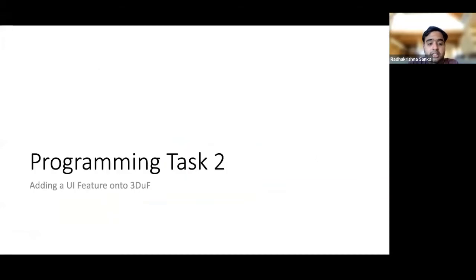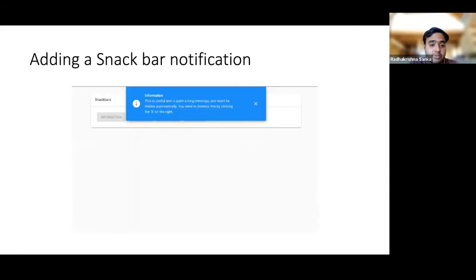Now the second task is adding a new UI feature. So in order to add a new UI feature, how hard is it to add something to 3DuF? And that's the good thing about version 2 of 3DuF. We've simplified how you can go about adding features, and just like how you just had to look up paper.js code, now all you need to do is look up Vuetify.js, because we use the standard UI library for doing this. So because we have a standard UI library, it's easy to just look up what UI components are available and create your own new workflow without any hassle.